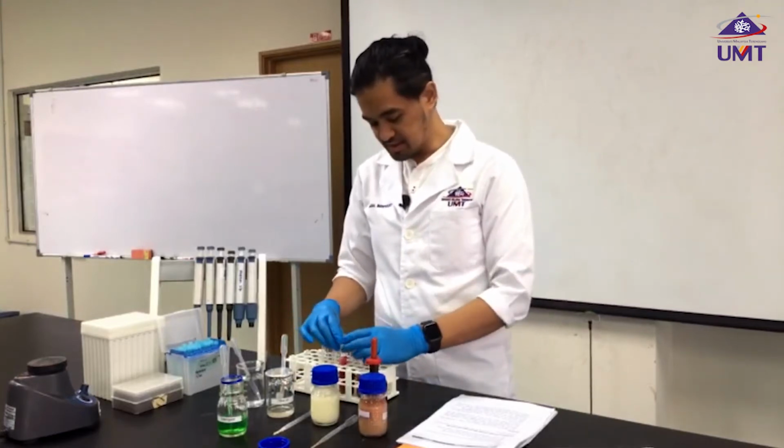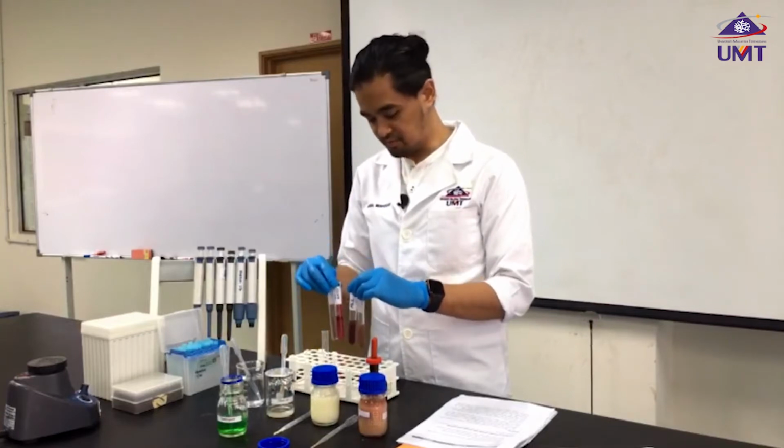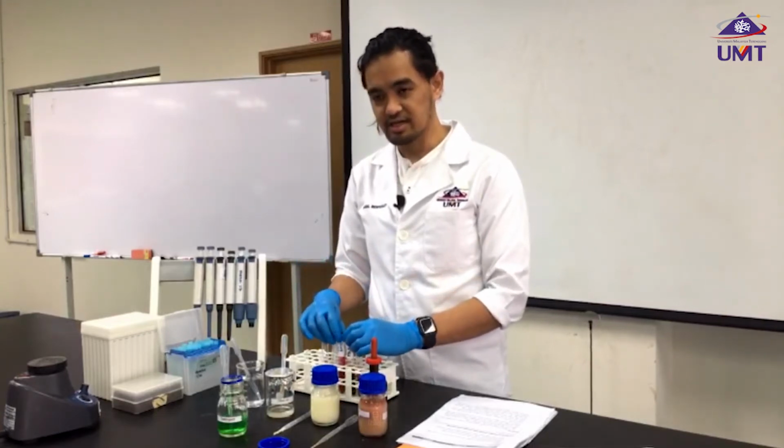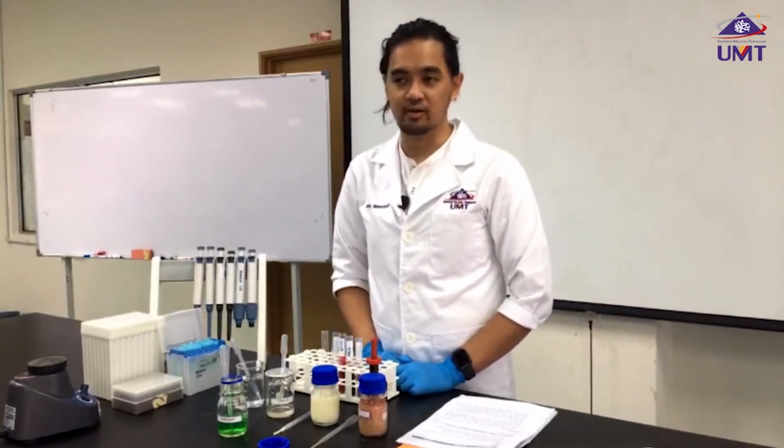So this is the end of our first experiment. Before we continue our experiment, make sure in the report you answer all the questions as well.